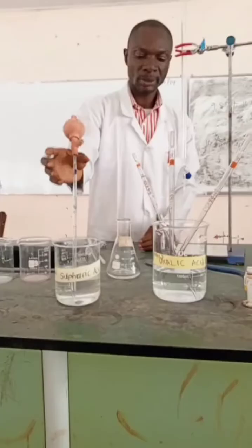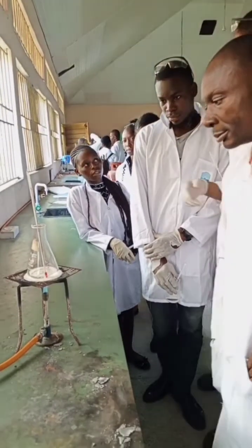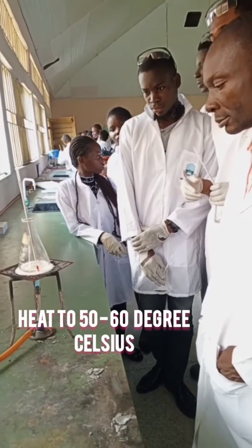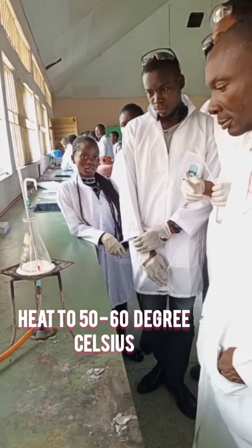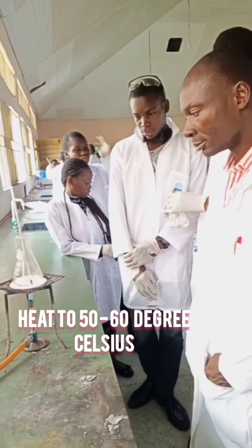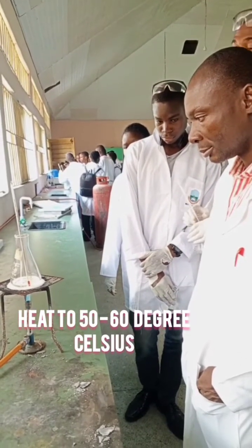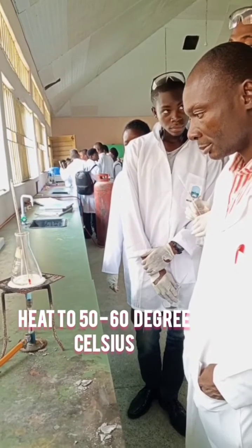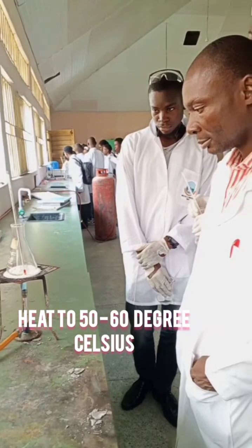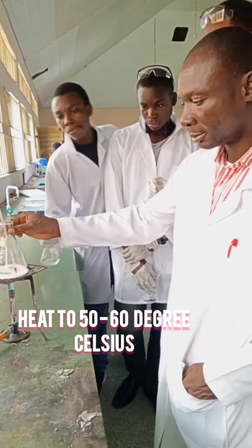After that we are ready. What we need to do is take it to the heating stand with our Bunsen burner. We heat it to 50 to 60 degrees Celsius, because the reaction cannot successfully take place at room temperature. That is the essence of heating the mixture to that temperature.